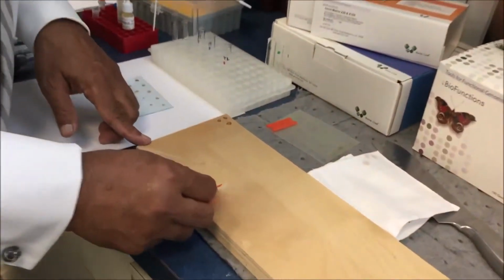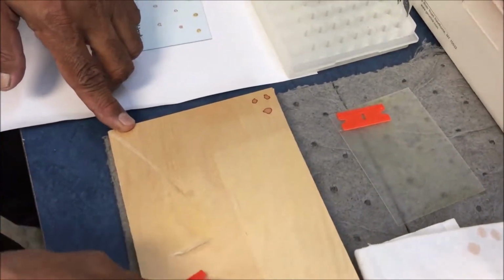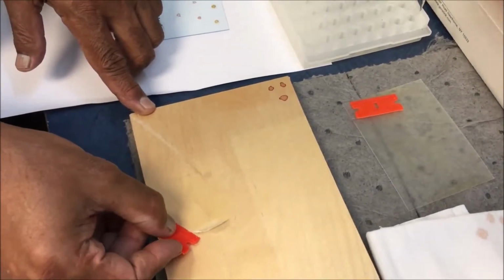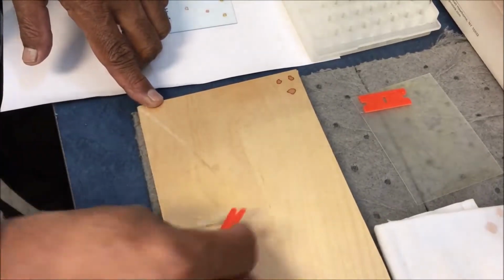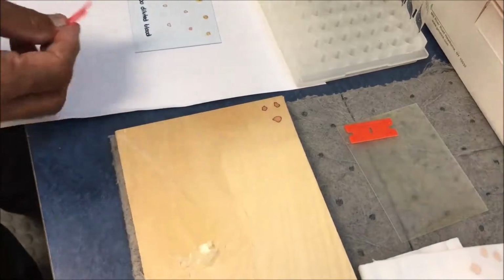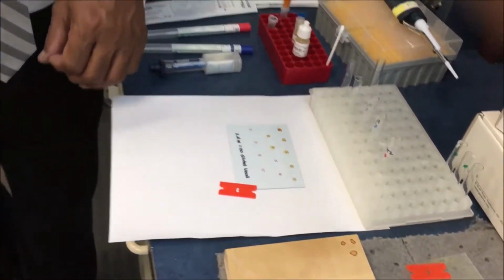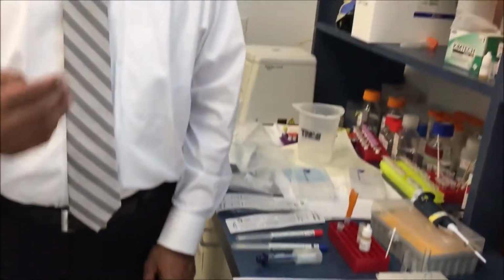And we are going to show you how to scrape it. If this is an area which is already sprayed and there was a fingerprint here, we will pick it up like this and then deposit. And in the next session, we will show you an actual demonstration of sample collection, and then we will proceed into sample processing also.